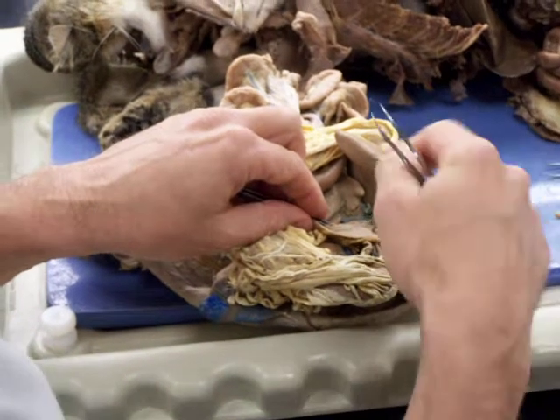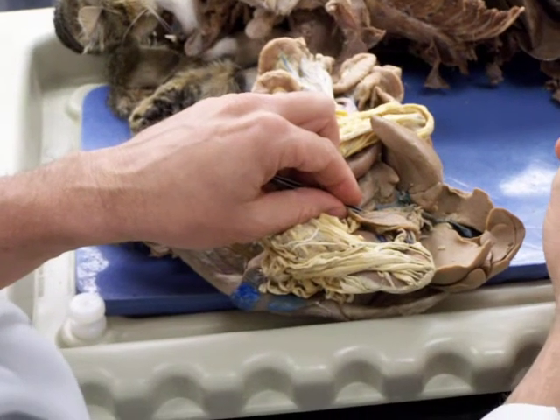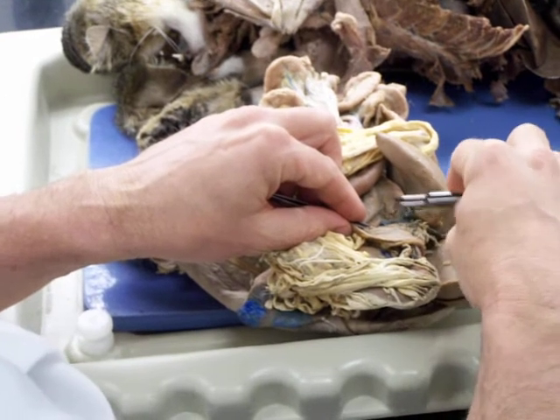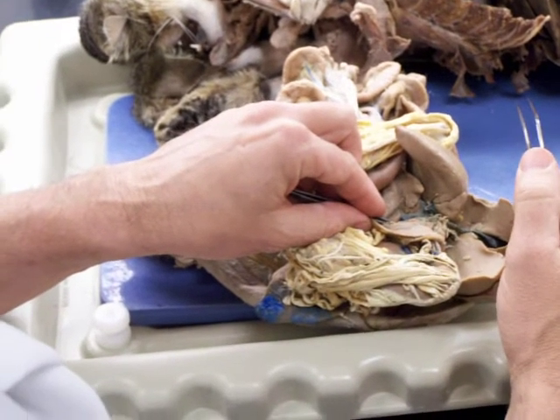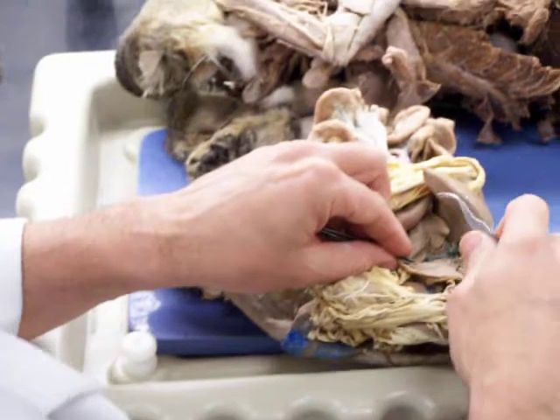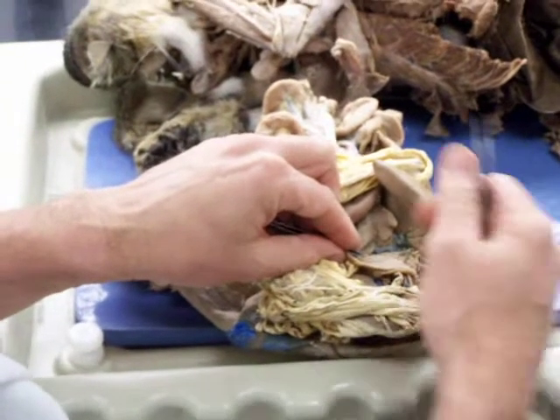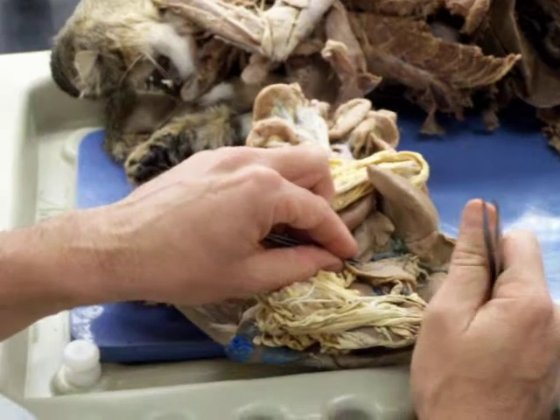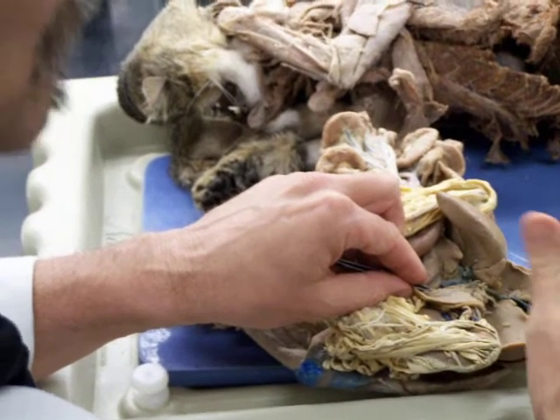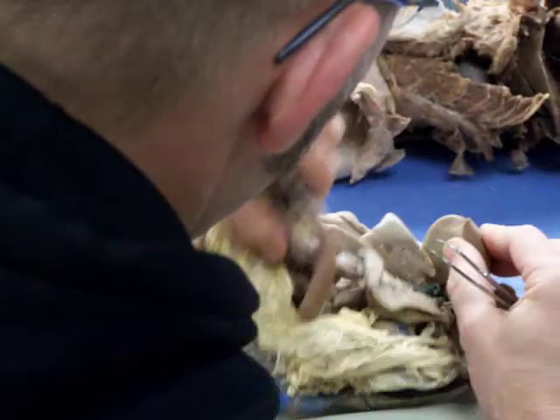That hepatic artery is supplying oxygenated blood to the lobes of the liver. The liver also gets a lot of blood from the hepatic portal that we'll see in a few minutes. That blood is oxygen poor, but it's rich in nutrients from the gut. So the cells in the liver get oxygen from the hepatic artery, and they get nutrients from the hepatic portal, and they store those nutrients or package them to send them to the rest of the body. Anyways, the hepatic comes up here and goes to the liver.